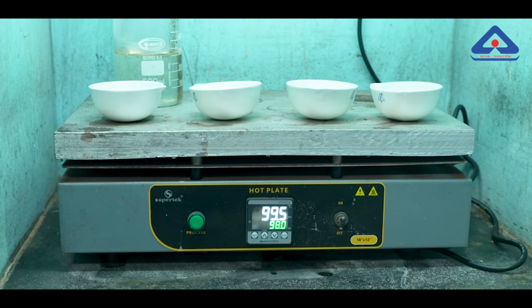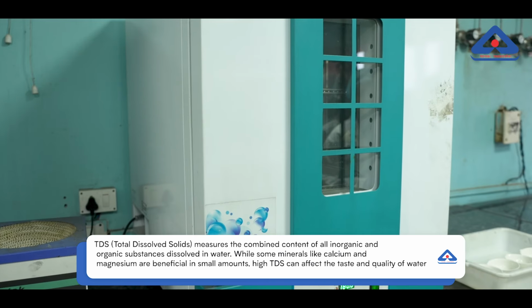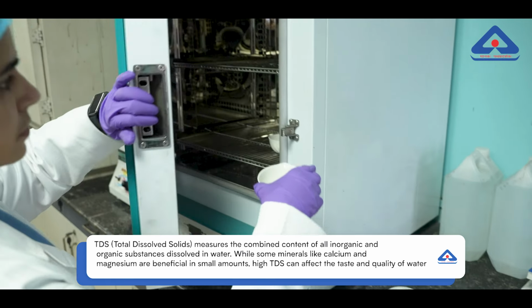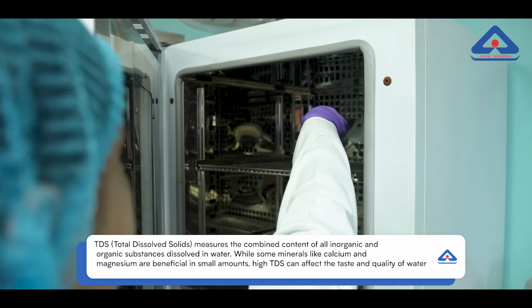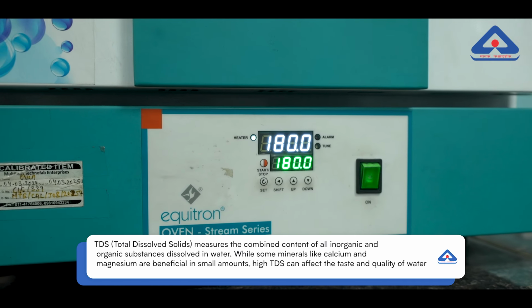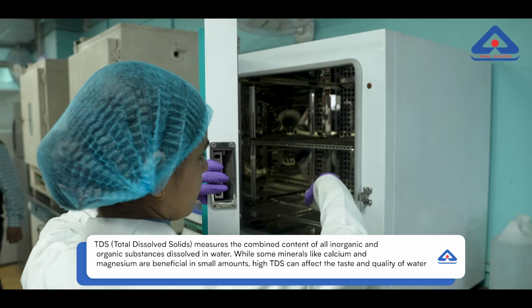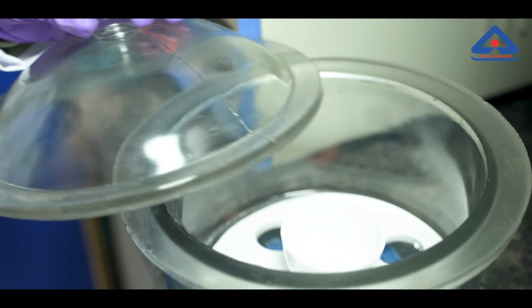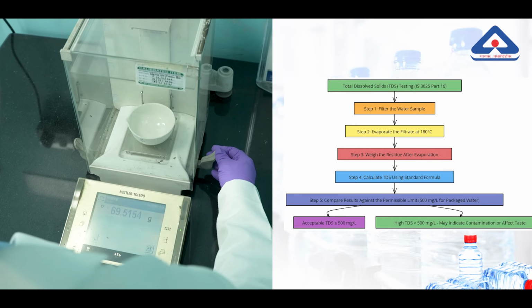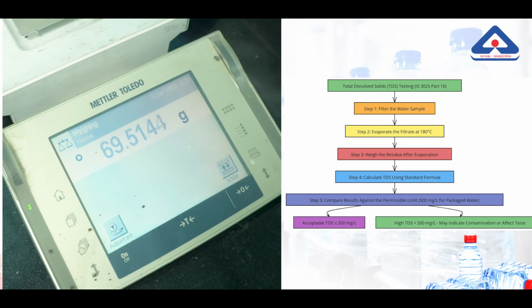The sample is first heated on a hot plate set at 98 degrees Celsius until most of the water evaporates. The dish is then transferred to a hot air oven, maintained at 180 degrees Celsius, to ensure complete drying of the residue. Once evaporation is complete, the dish is cooled in a desiccator to prevent moisture absorption and weighed again. The difference in weight represents the TDS content.